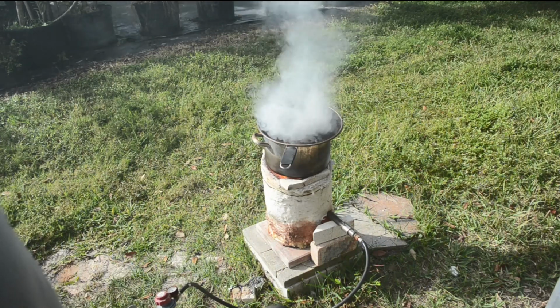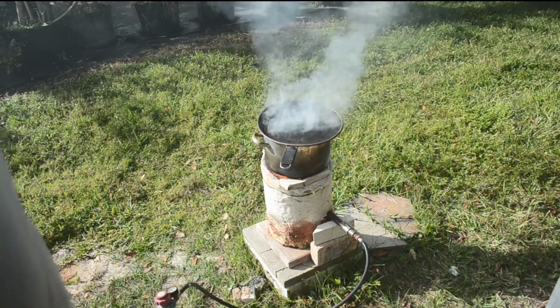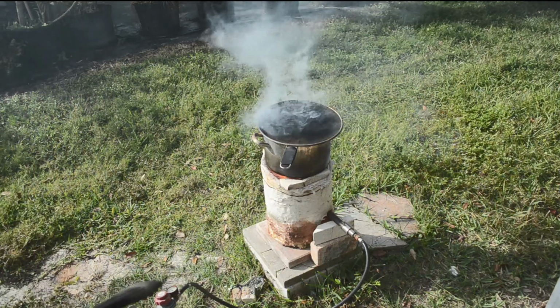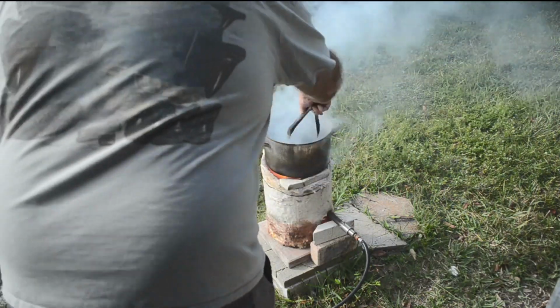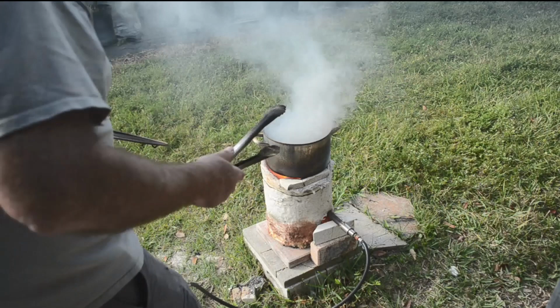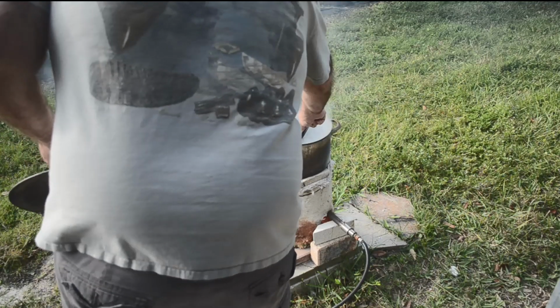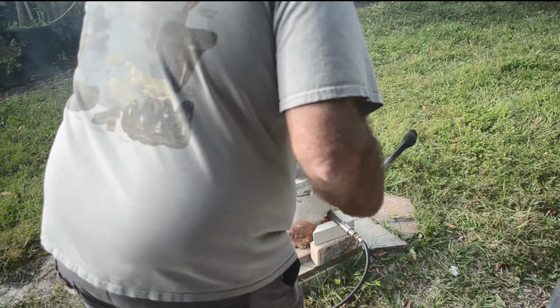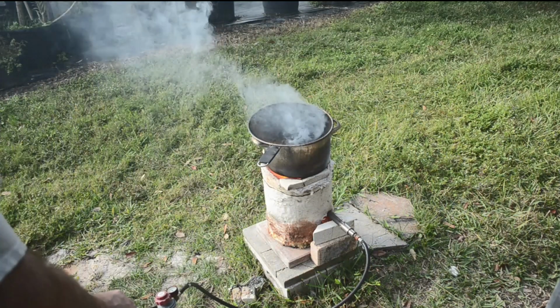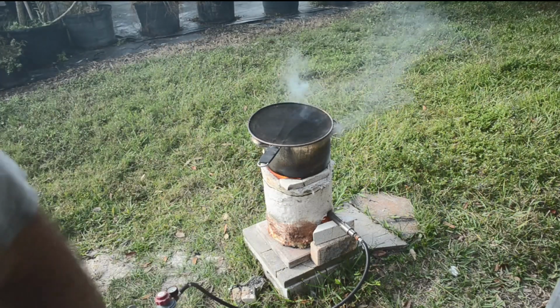So I didn't think this was going to be so dramatic, but oh my goodness. You can fill the whole neighborhood up with smoke. But wow. That whole bag of material cooked off down to almost nothing in about 2 minutes. Wow. And it's still flaring up in there a little bit. Well, that's going to get me done quicker anyway, as long as nobody calls the fire department on me.